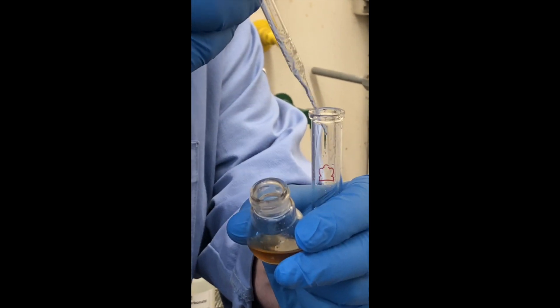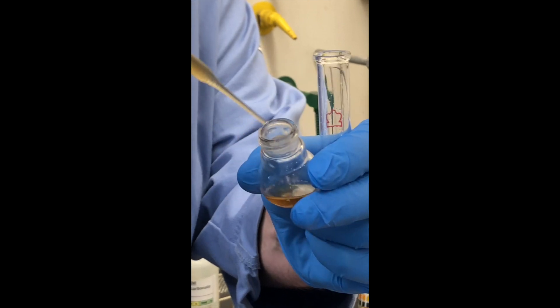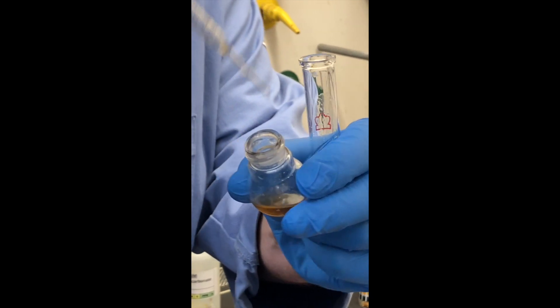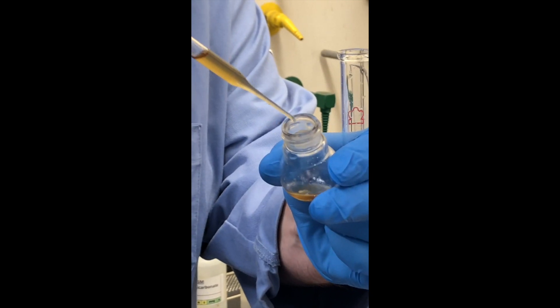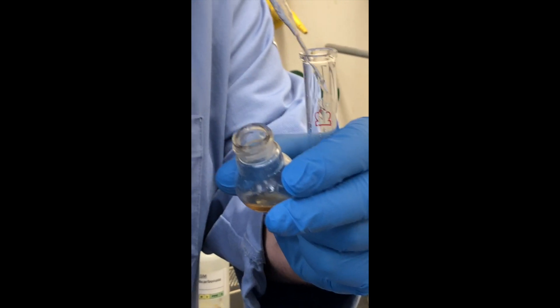I guess we could have poured it a little. I didn't want to spill it down the side. This is the best way to avoid getting the boiling stone in there.